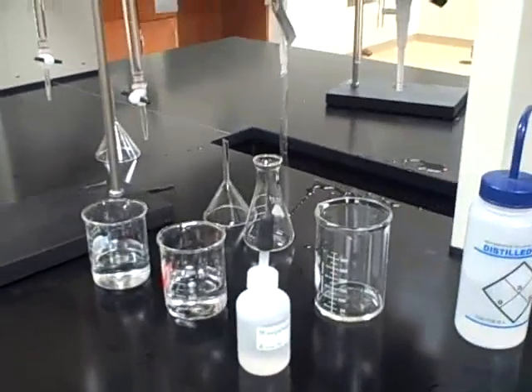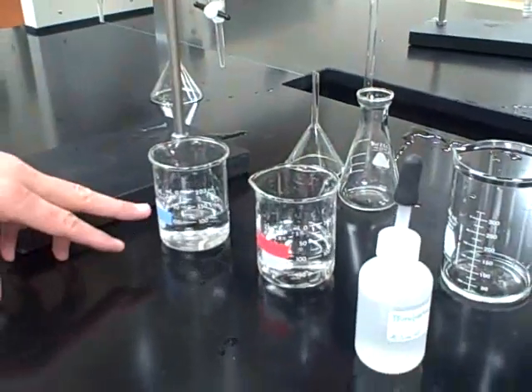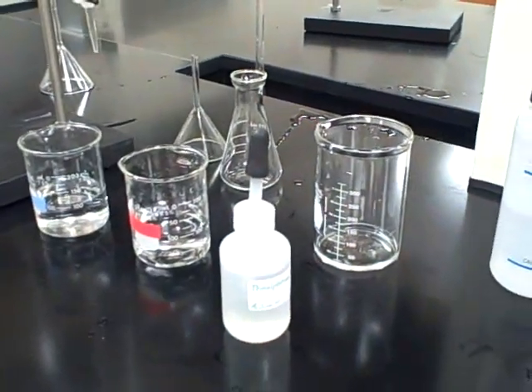The instructions say students should have 100 milliliters each of an acid and a base. The base is flagged with blue tape, and the unknown acid is in red. The concentration of the base is up on the board.